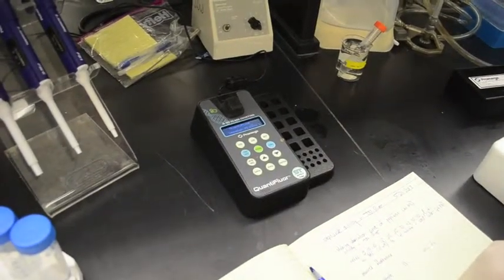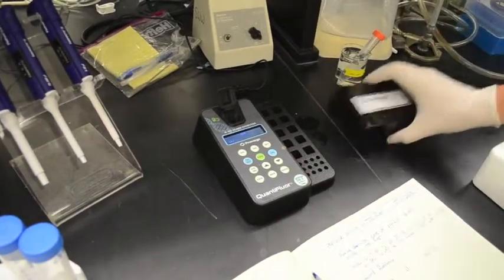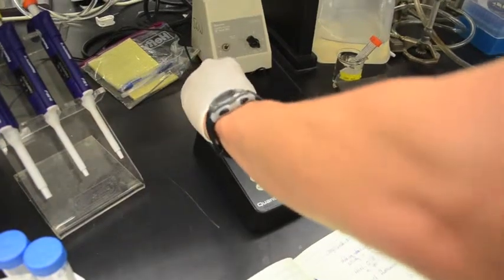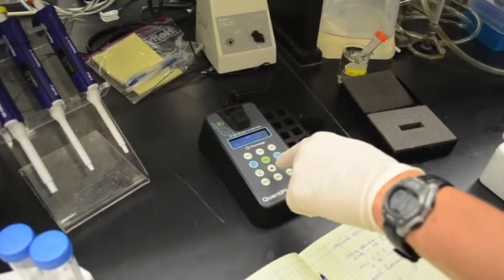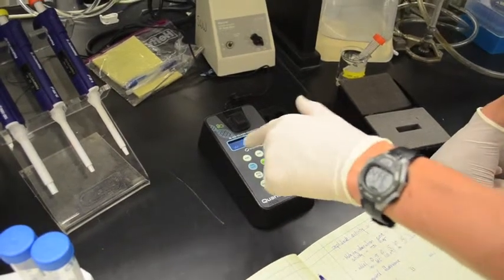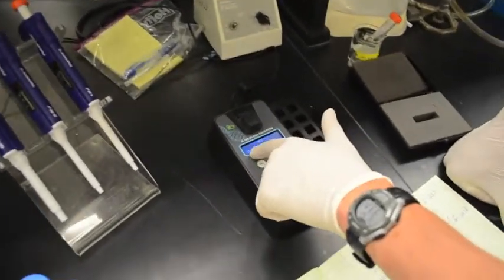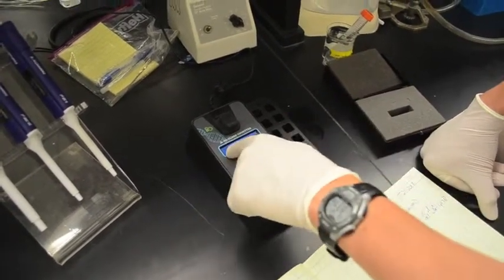It makes us wait 5 seconds. Before we measure any samples, we want to take the solid standard out of this little case here. So the solid standard is just a reference to tell us whether the instrument response, or the amount of fluorescence it reports, is drifting or not. By the way, before we measure this, the only thing we have to do is make sure that it says UV down here and not blue. If it says blue, press AB and make sure it says UV.